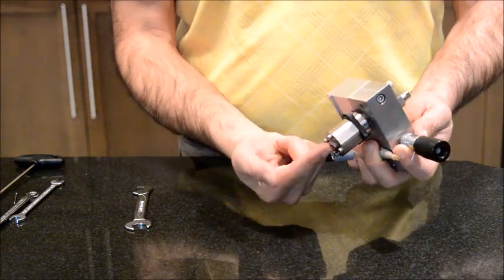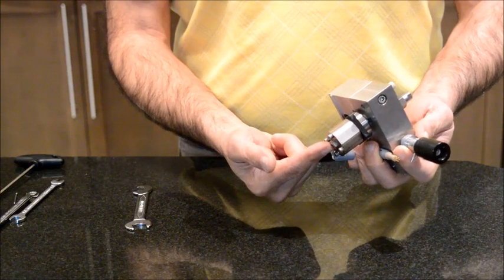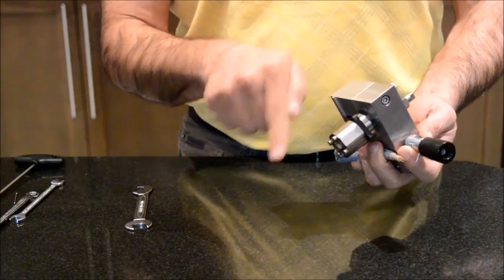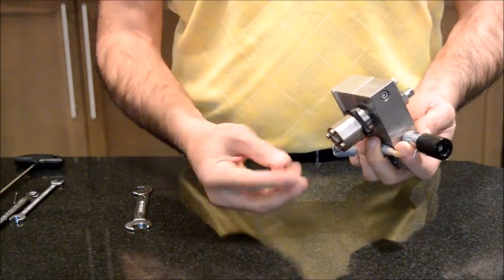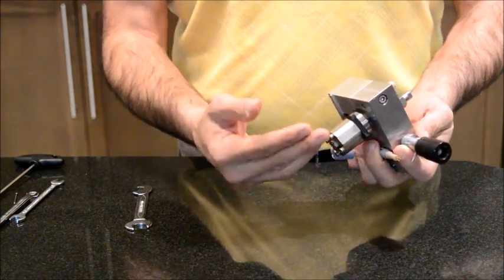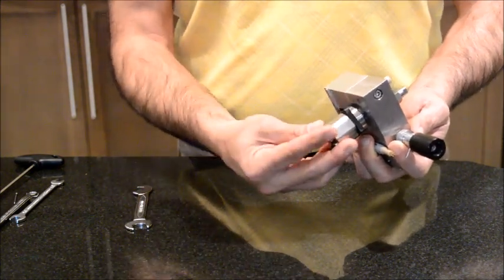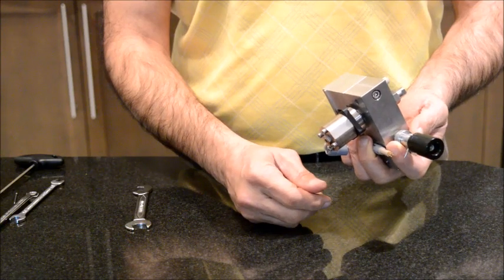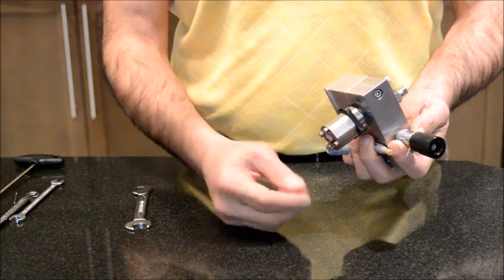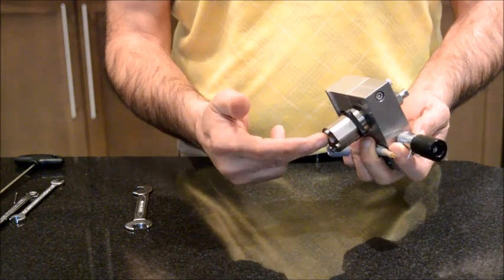This part that we see at the bottom, they call it the active inlet valve. What it does is that it allows the mobile phase to go through the pump head but prevents it from coming out due to the back pressure. They call it active because this unit is able to remove the air bubbles that are going to the pump. This unit is standard for all the Agilent HPLC 1100, but for the 1200 and 1260 series, this becomes optional. So you could buy either the active inlet valve or the passive inlet valve.